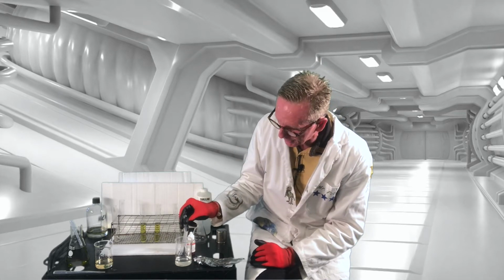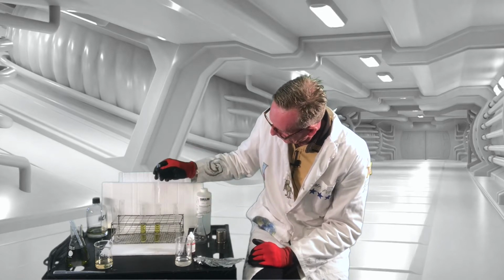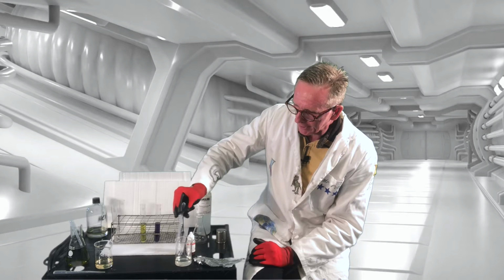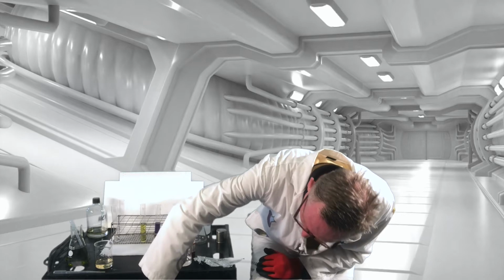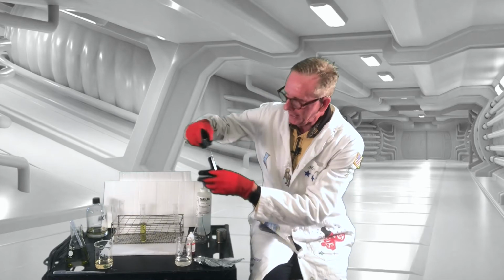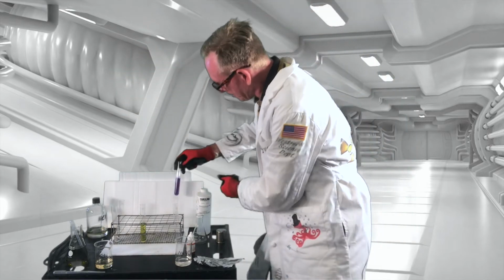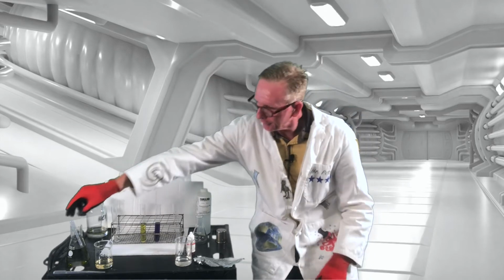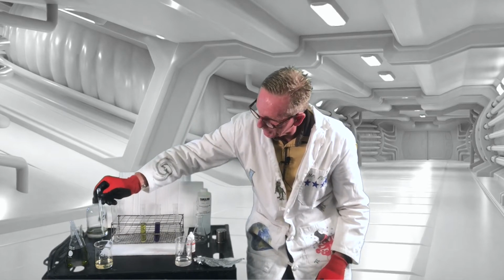So once again, sodium hydroxide. Do a few test squirts here. So 1, 2, 3. I got 3 pretty good there. I don't want to leave this in it long because it is kind of a strong enough solution. I just have a beaker of water down here that I can kind of rinse it out in. And if we shake that up, get a pretty bright purple color. And over here, where'd it go? My pipette. Same thing, I want to try and get 3.